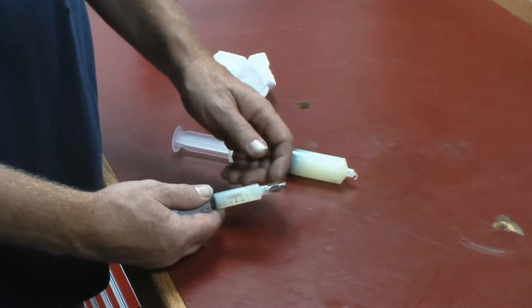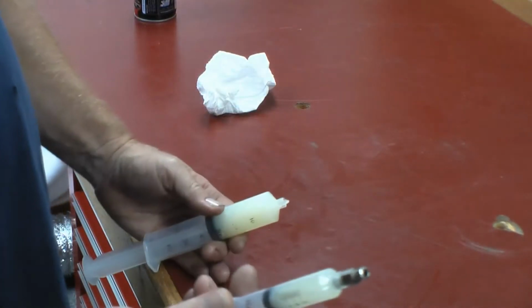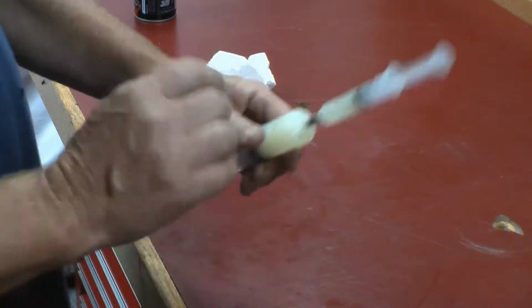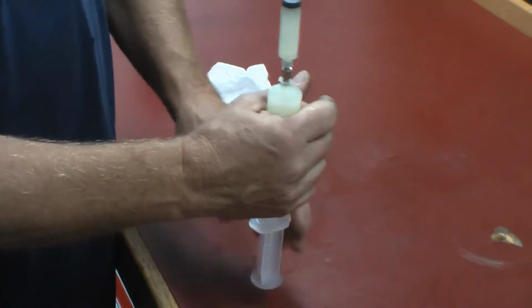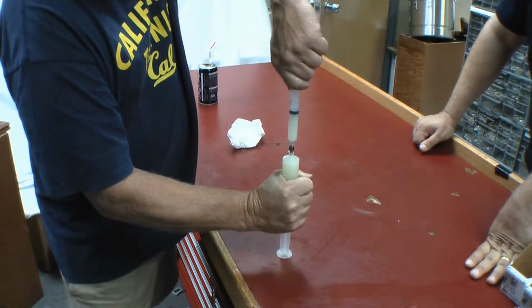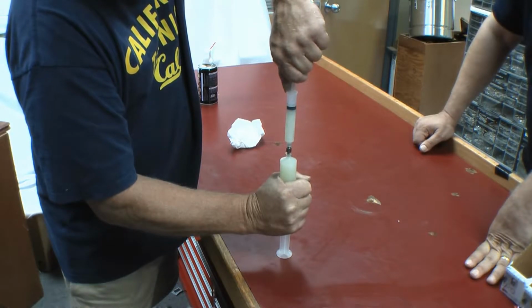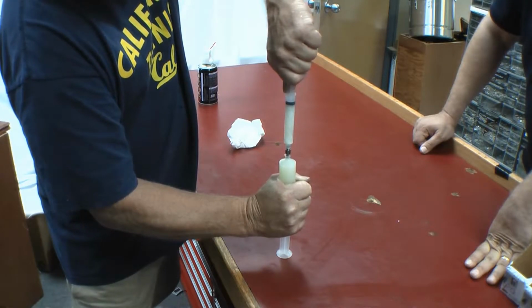Couple different techniques. One of them is where you take a full unit and an empty unit, and you'll put them together with a, I think it's a double female luer connector. Then you will hold the source and press down lightly while pulling backwards and putting a slight vacuum. And this should load it right up. And basically this is a hydraulic jack in backwards.